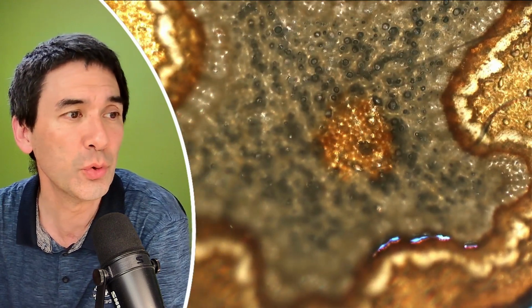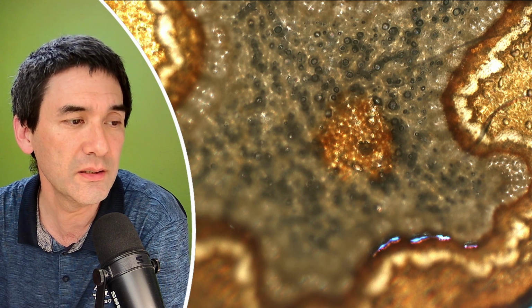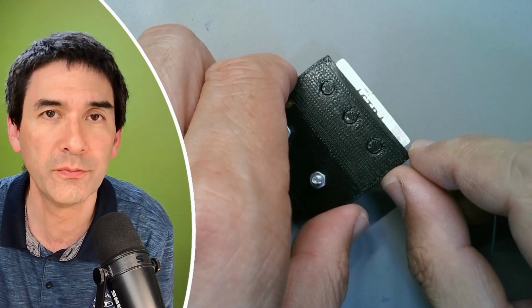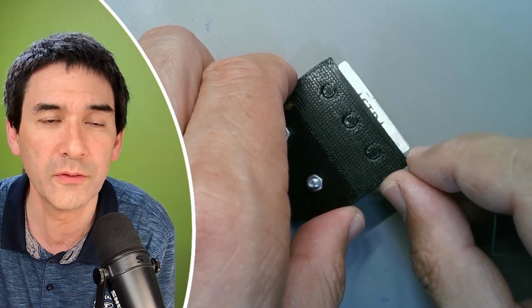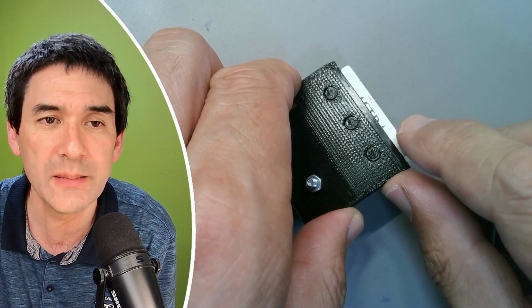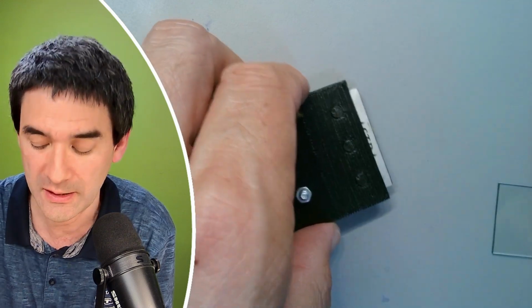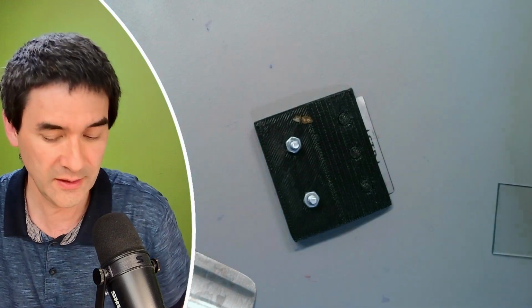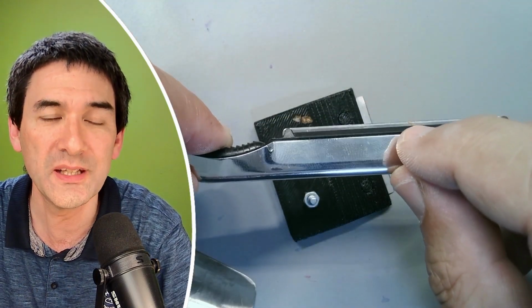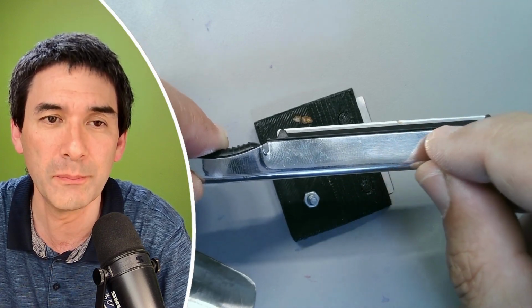I just want to show you a couple of other things here that I realized. Now, when we look at the razor blade, you can actually see that about 4 or 5 millimeters of the blade is visible. This means that when I cut the specimen, the cross section is able to glide on the top surface of the blade. Look at this over here. In contrast, this one over here is much more narrow. And therefore, there is the danger that when you cut, it actually gets stuck here on the black edge.